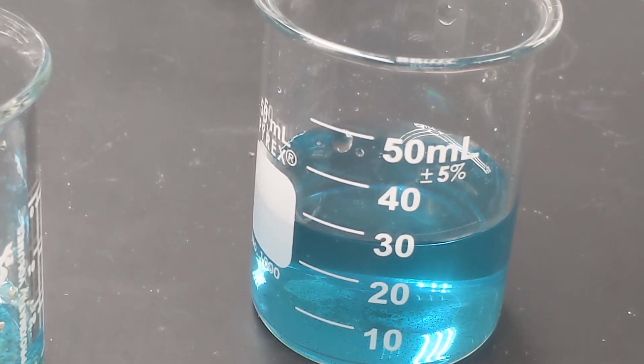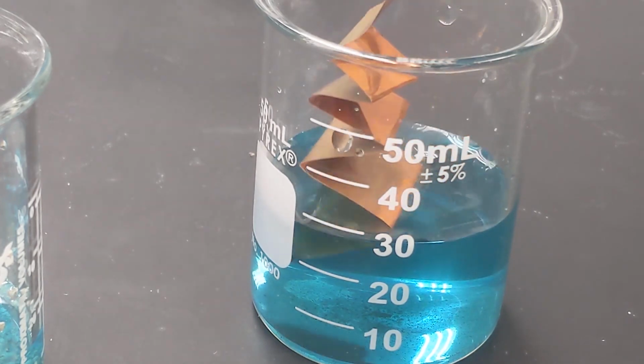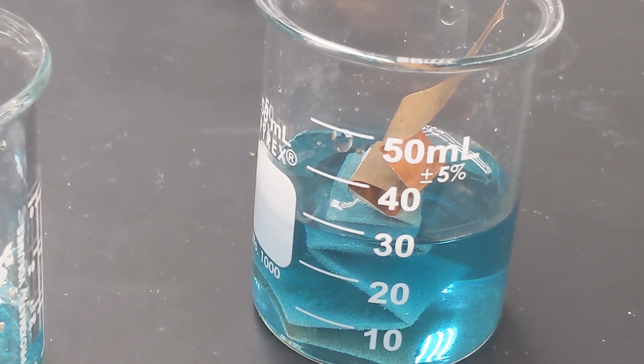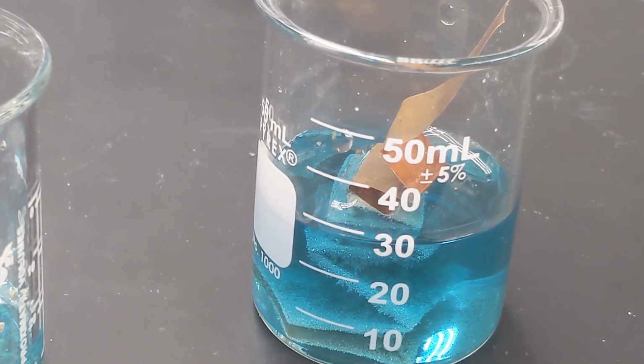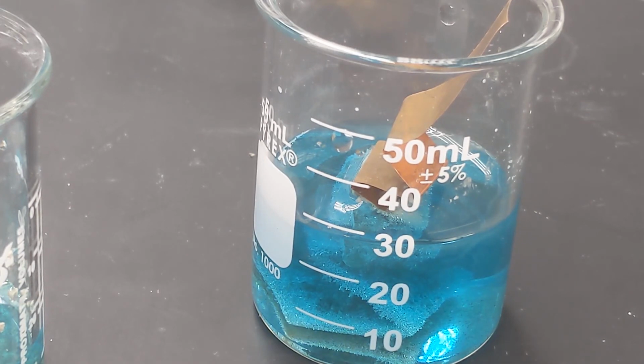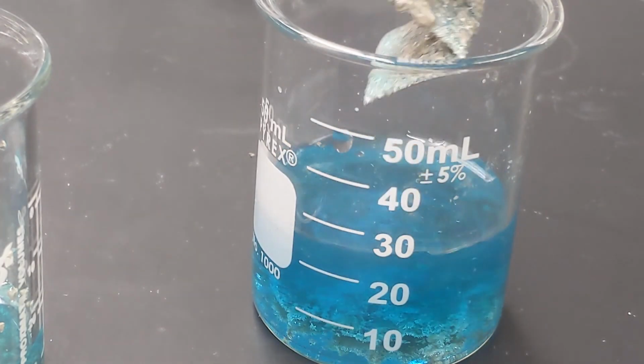And what I had done there is I had exposed the silver nitrate directly to copper, and the copper in a displacement reaction directly precipitates the silver. And the best part about this reaction is it's super cool to watch and it's very direct and it seems really easy. So that's what I had decided to do, and that's where my downfall was. Let's get a couple more shots of this happening because it is really cool. And that way you can appreciate some microscope images and stuff before you see what exactly my downfall was.